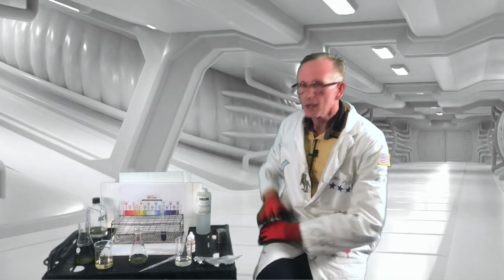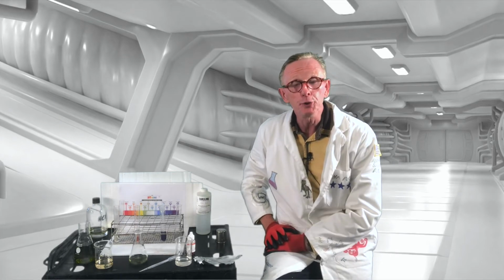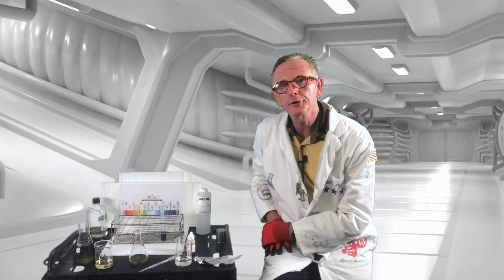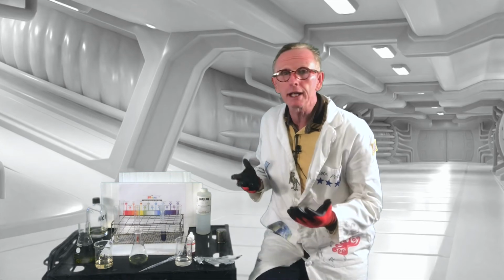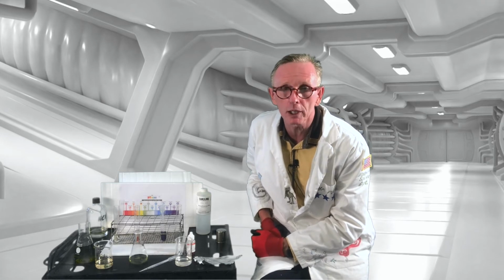Well, that pretty much wraps up the experiment. You now need to draw your conclusions. Well, was your hypothesis supported or not supported, or was your hypothesis inconclusive? It all depends on what your original hypothesis was.